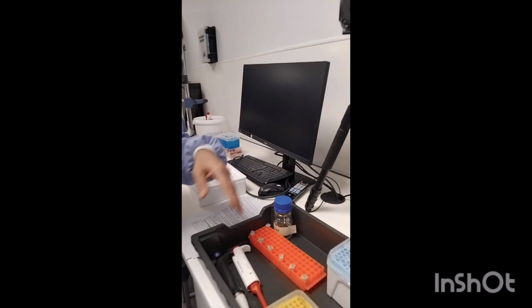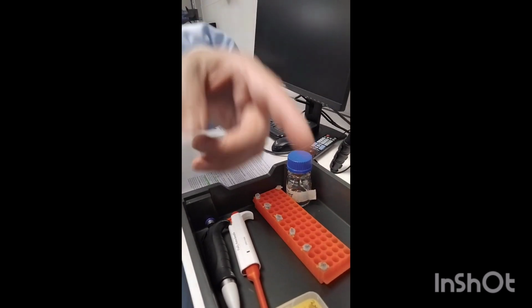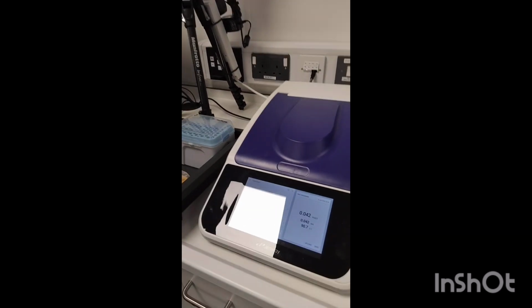You repeat the same. Add 3 ml of buffer to the cuvette, then add substrate, blank, then add enzyme, put it in the spectrophotometer and sample it every 15 seconds. So repeat the same experiments with the same manner of calculations 3 times. After that, you can take the average of the 3 initial velocities we have.